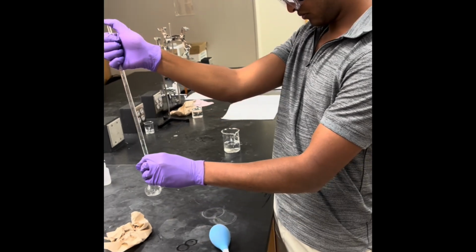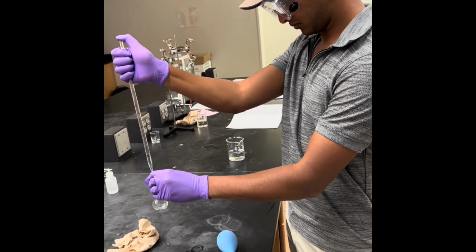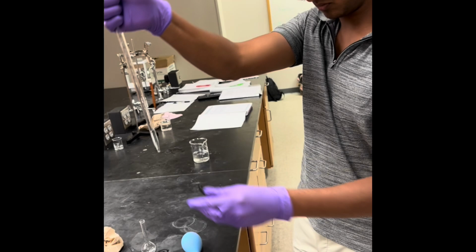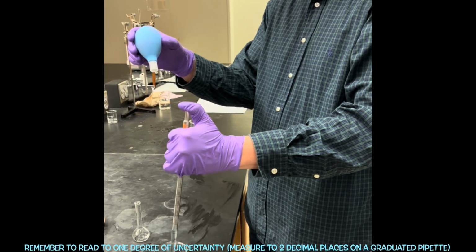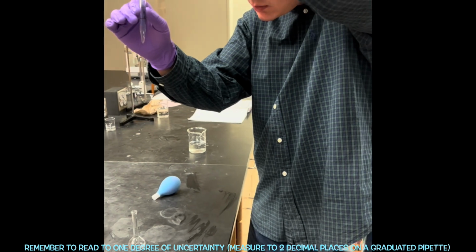The meniscus of the solution in the pipette is read by all group members before the solution is transferred. The solution is then transferred into a volumetric flask using the pipette.